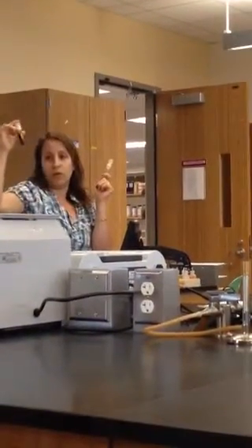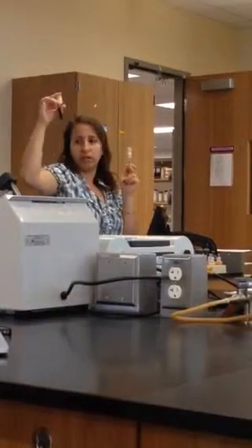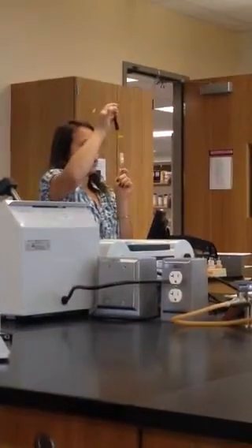Why is the test called the bile-esculin test? What is the function of the bile? It inhibits the growth of other bacteria — not a lot of bacteria can tolerate the bile. Enterococcus is one of the bacteria that can tolerate bile and can also break the esculin. So that's why, if we suspect that we have Enterococcus faecalis, we use the bile-esculin test.